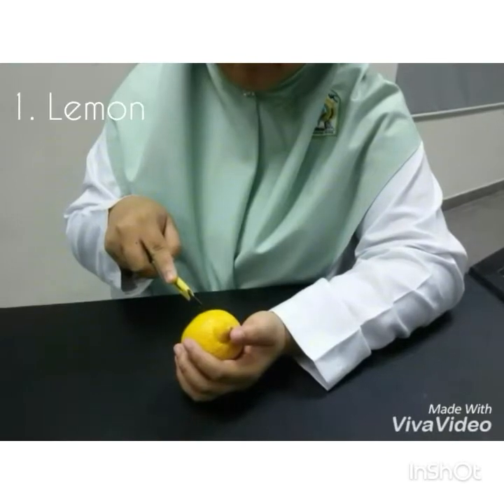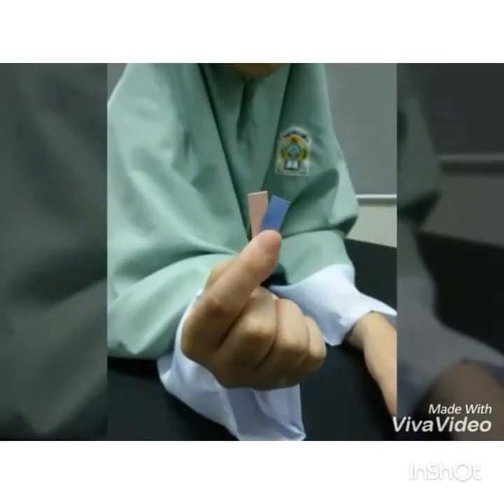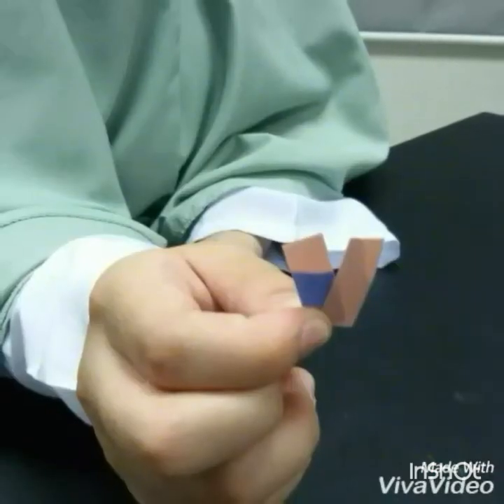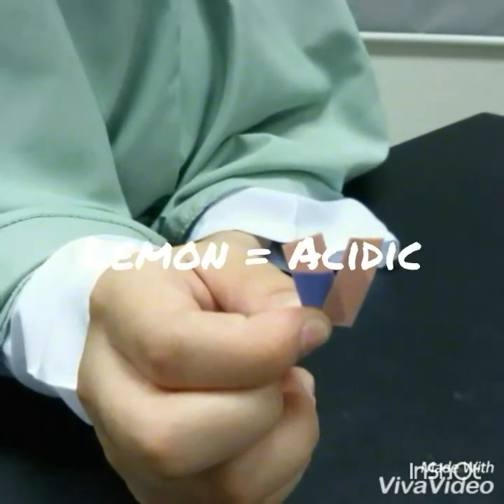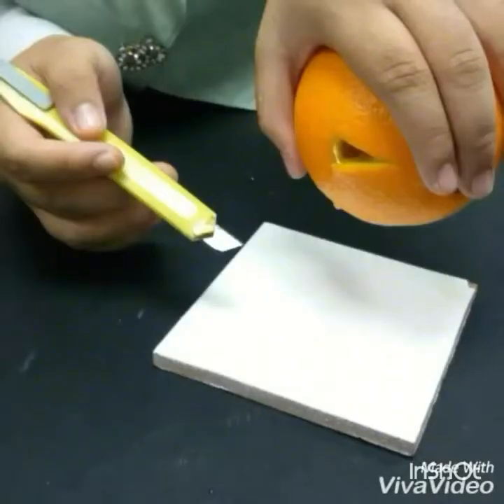What we're going to do is cut the lemon and squeeze a little bit of juice onto the white tile. Then we dip the blue litmus paper into the lemon juice, and the red litmus paper. As you can see, the results are that the blue turns to red and the red stays the same color, which means lemon juice is acidic because acid turned blue litmus paper to red color.